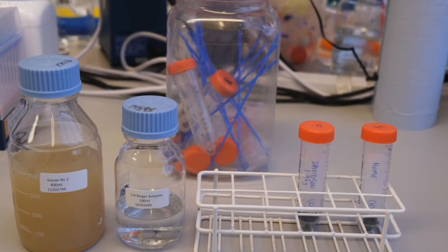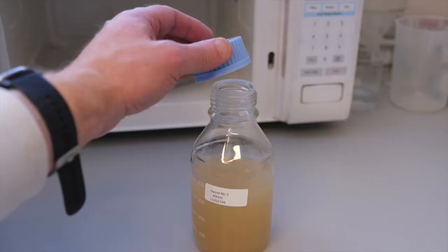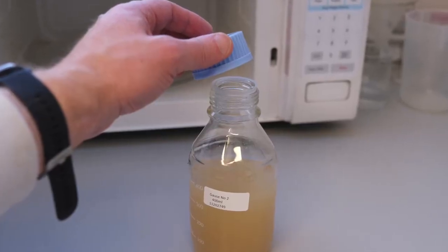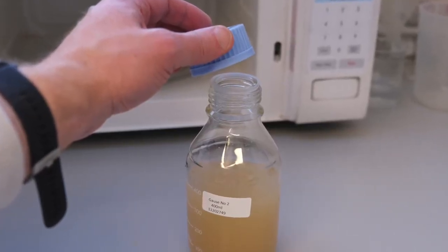Gather everything you need. We melt a bottle of agar and pour plates as shown in a previous video.